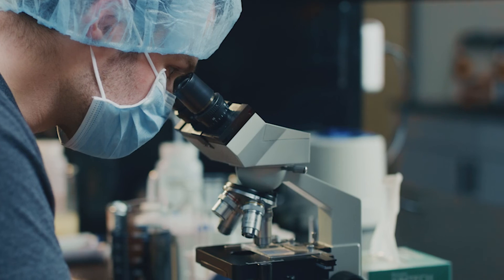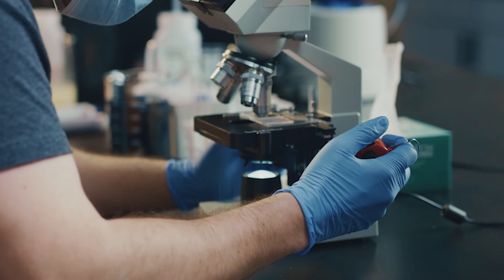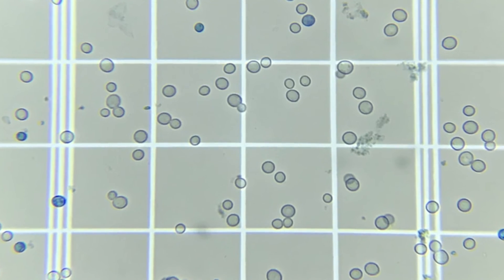Use the fine focus knob to pull the lens away from the slide until the grid and the yeast come into focus. Once in focus, count all of the cells in the 25 square grid using a hand tally. Count all cells, including buds, as long as they are at least 50% of the size of the parent cell. Separately, count the dead cells with another tally. Non-viable cells will stain blue; live cells will be clear. There will often be cells stained lighter blue, and deciding where to draw the line between stained and clear is up to you — the important thing is to stay consistent with how you choose to identify them in your brewery. Repeat the count starting on the other side of the hemocytometer. Both counts should be within 10% of each other; if not, clean and reload the hemocytometer and perform another count.